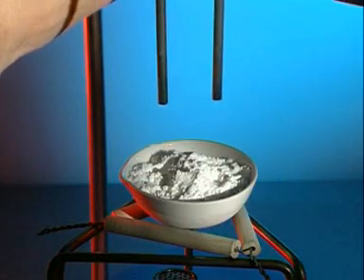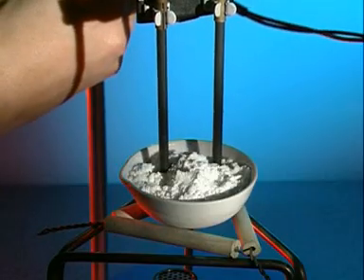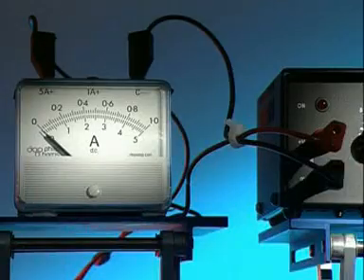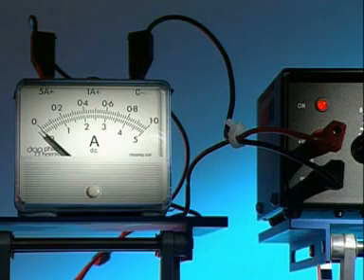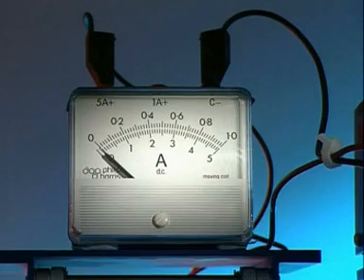The white powder is lead bromide. Switch on the power supply and nothing happens. The ammeter reads zero.